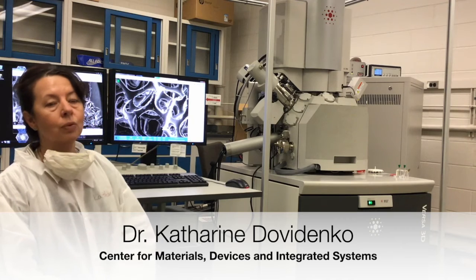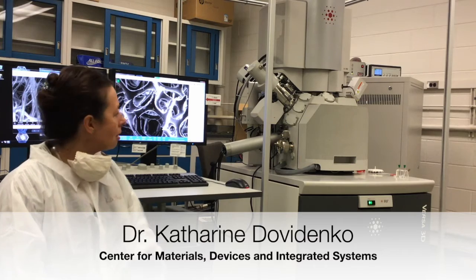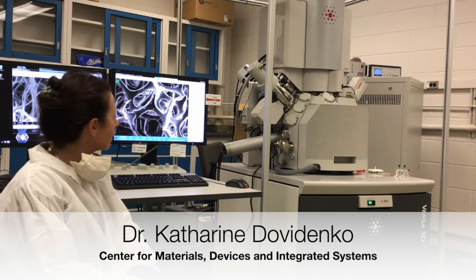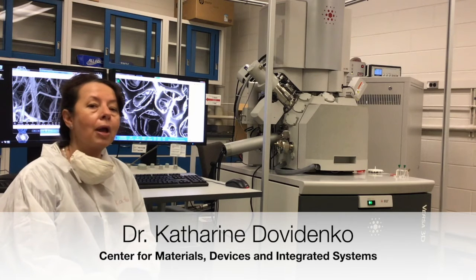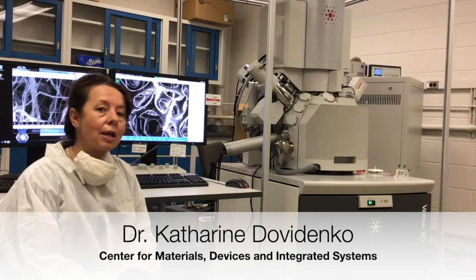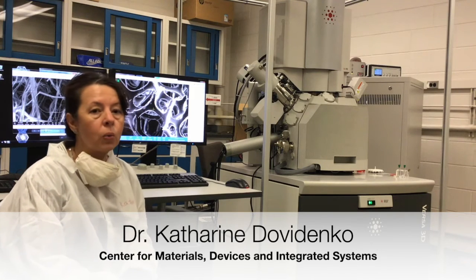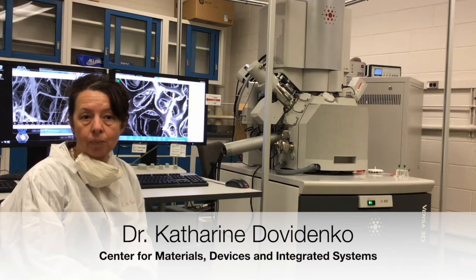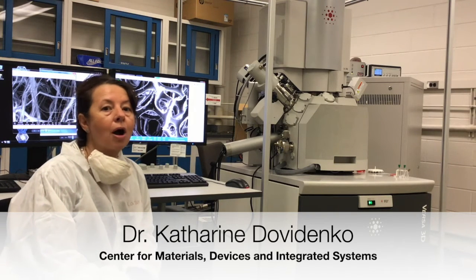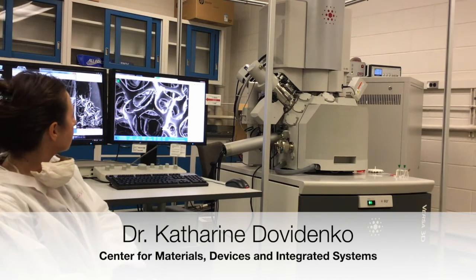So here on the screen, we have an example of only one of multiple materials that can be analyzed. Here we have an image of a packaging foam. It's a regular packaging foam that can be put under the microscope and imaged under certain conditions. It's a non-conducting material, so in this case we're using a special function of this particular model of the microscope, which is low vacuum, or actually a little bit higher pressure. We add a little bit of water vapors inside the chamber, so we could image a non-conducting material like this.